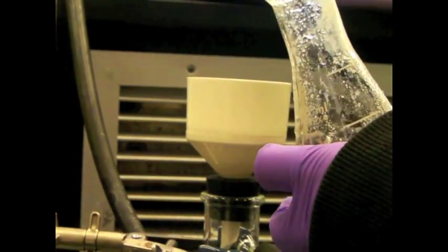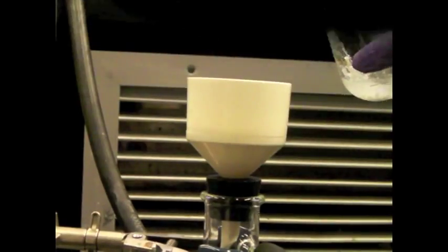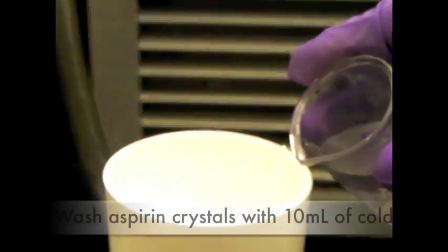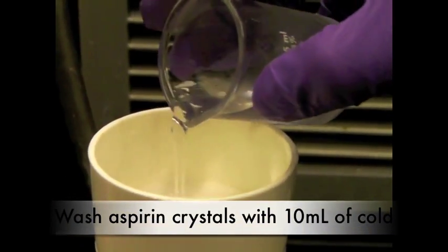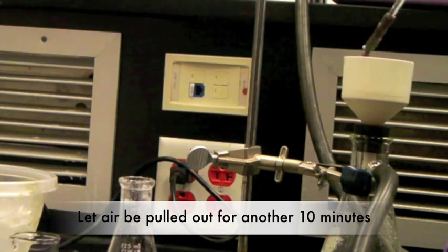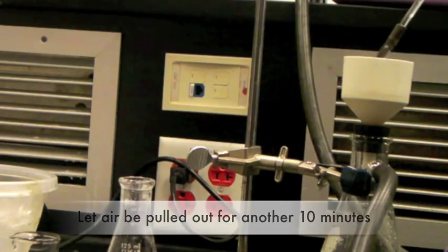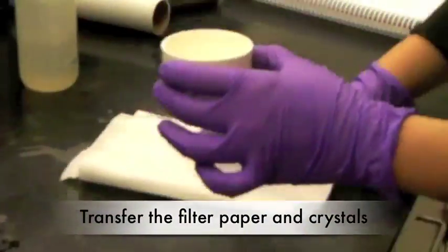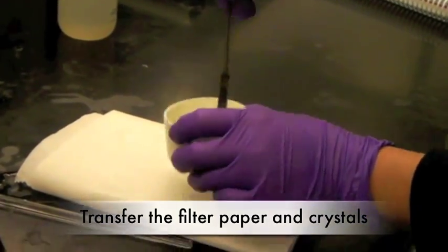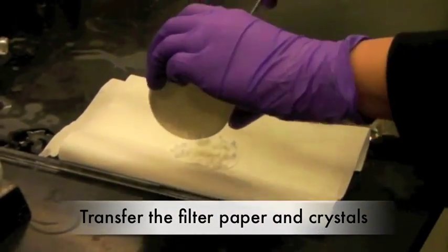You can also rinse your flask with cold DI water to reduce the loss during transfer. Wash the aspirin crystals with 10 ml of cold DI water. Continue to pull air through the crystals in the Buchner funnel for about 10 minutes. Transfer the crystals and the filter paper to a dry paper towel. Allow them to sit and dry for 10 minutes.